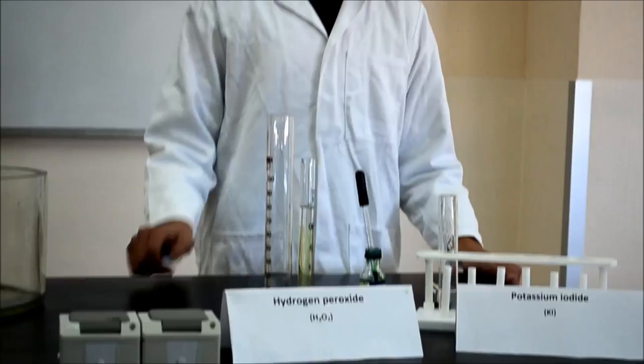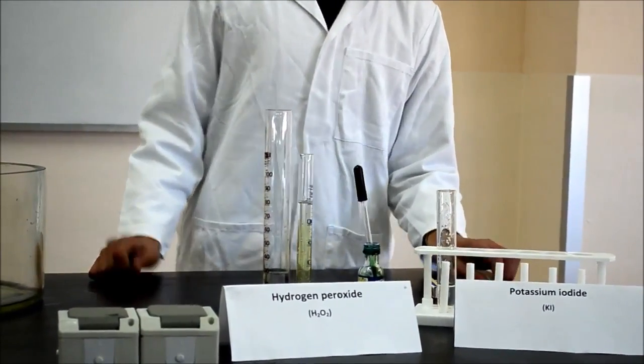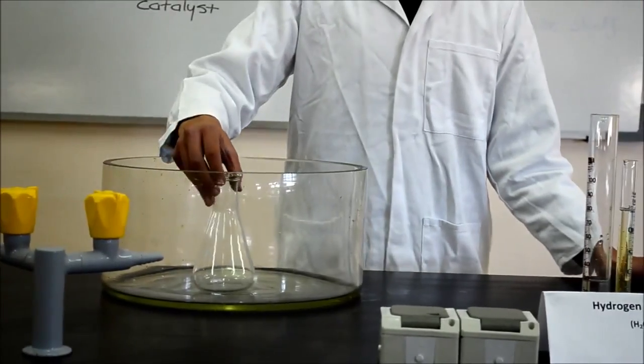As apparatus, we will be using some measuring cylinders, a test tube, a stirring rod, a pneumatic trough, and a conical flask.